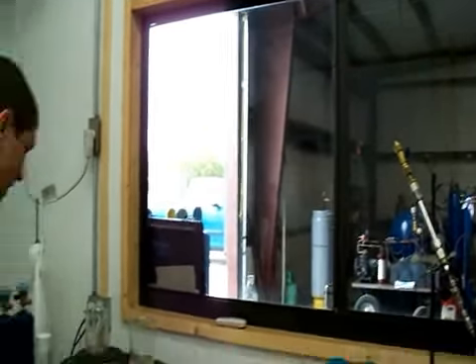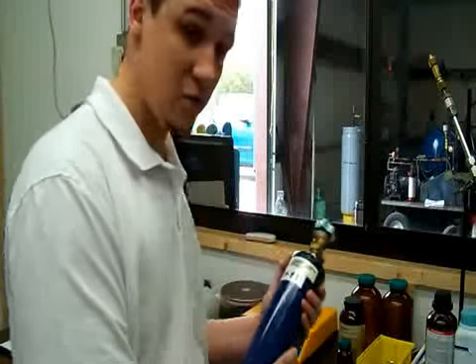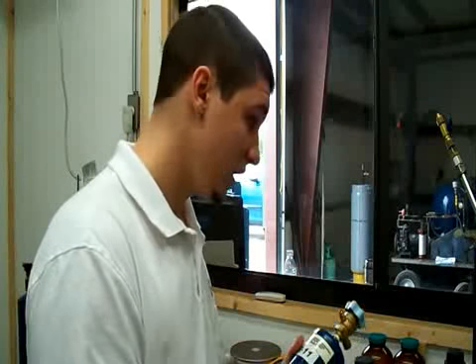These blue bottles here. We'll fill this blue bottle up to 2,000 grams, full to the scale. And it will represent one of our 10,000 pound tanks, which we have numerous ones. I think we have 20 or so in the shop, and we also have 5,000 pound tanks and half tons. We take one of these samples off, and we do each of those 4 tests to represent that tank. And they will send us back this bottle and also an EPA certification that will tell us our gas is good to send out to all of our contractors.